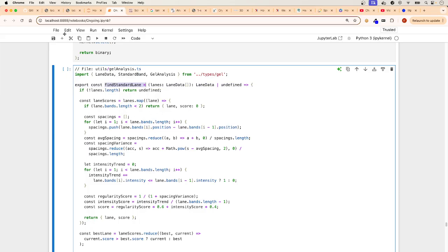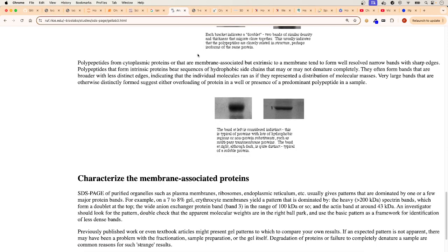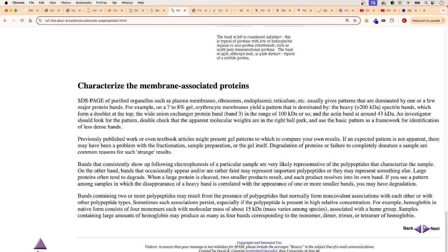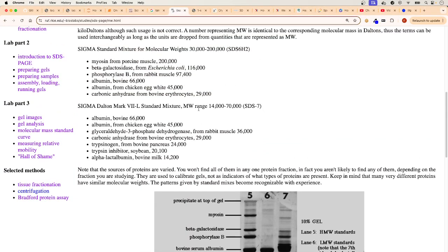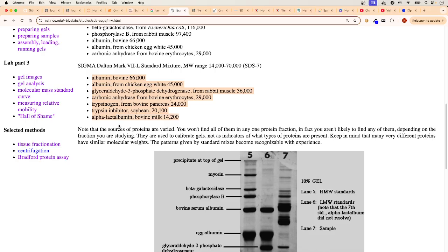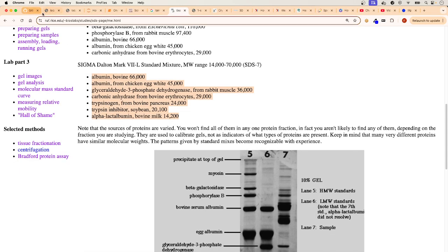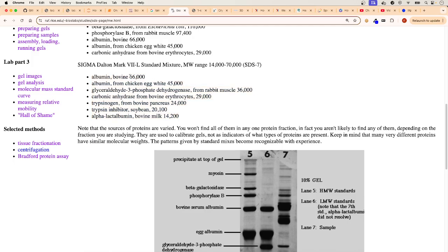It's finding that ruler, and basically it's looking for this ruler right here. Let's go back to our code here, because every gel is going to have what is called a range for that particular type of gel, right? So you're gonna have 14 to 70,000 for that one. You're gonna have 30,000 to 200,000, and so on. And you have calibration standards for that gel, and this is where these are coming from. They know that that particular protein, whatever standard is being used, is 66,000. He knows that at that particular level it is 45,000 from the top, is 36,000, and so on. That's where these numbers are coming from.